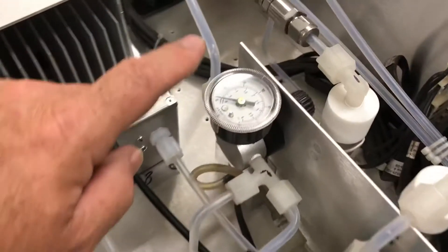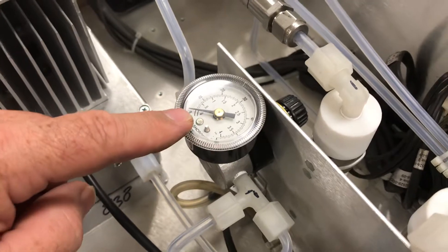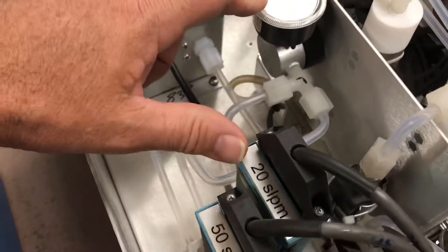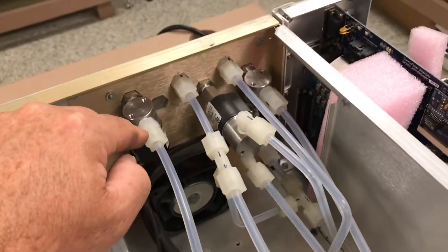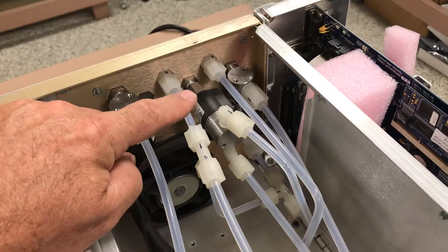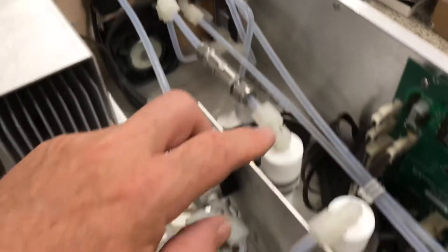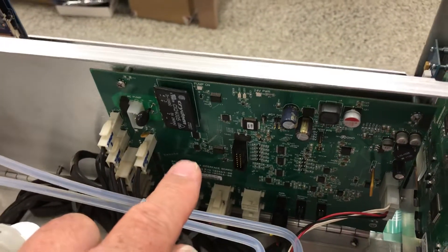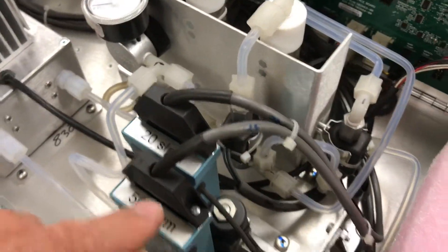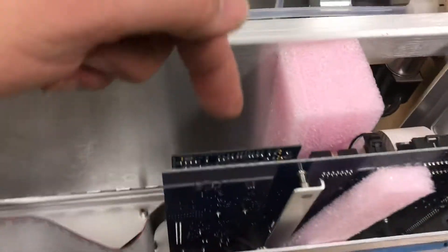The calibrator has a pressure regulator to control incoming air pressure and prevent overpressure to the flow controllers. There are switching valves in the back for daily zeros and span control, a couple of cleansing scrubbers, and another interface board for connection to the flow controllers. Coming around the sides, there's a standard DC power supply, a processor board and motherboard, and an option for output electronics.